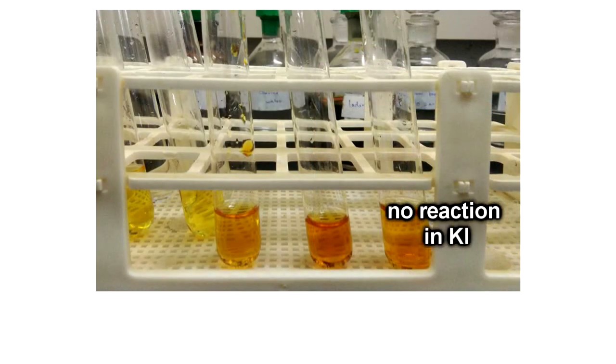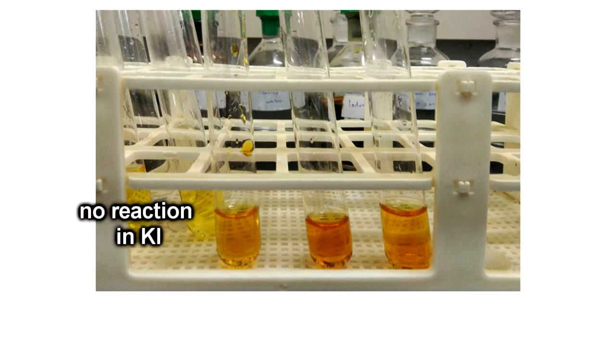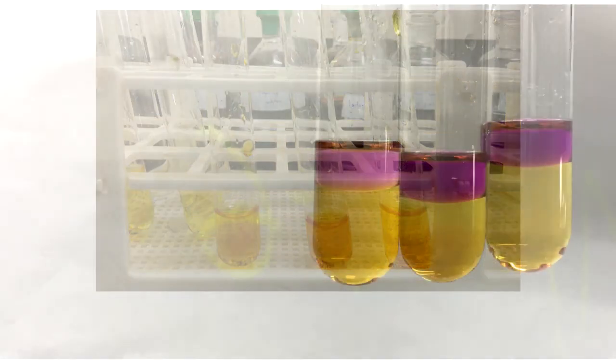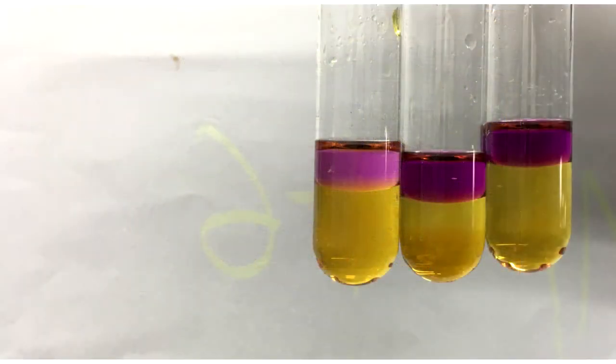For iodine water, no reaction occurs in any of the test tubes. When cyclohexane is added into the last three test tubes, the color of the cyclohexane layer is purple in all of them because it detects the presence of iodine, since no displacement reaction occurs.